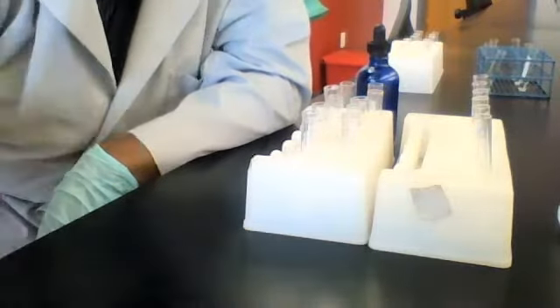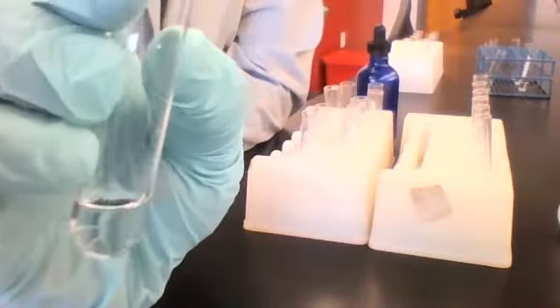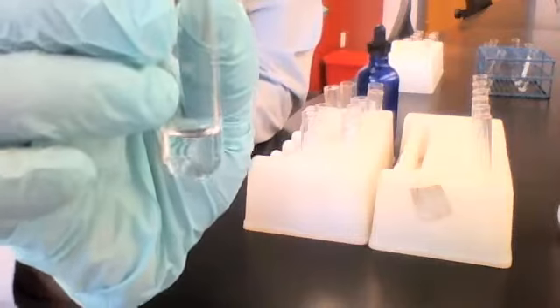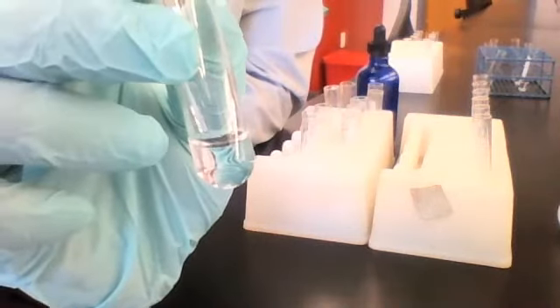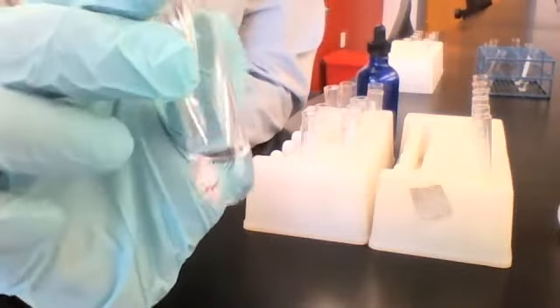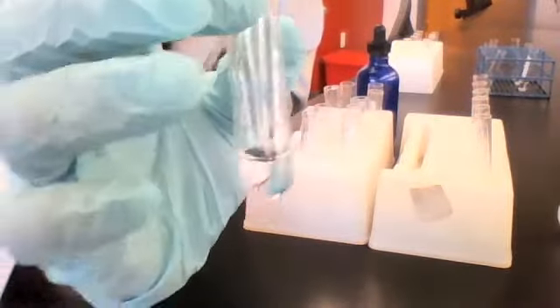All right, let's keep going across that first row of that first table. Our next solution is magnesium sulfate, MgSO4. This is what it looks like on its own. It is a clear and colorless solution. Clear because I can see right through it. It's completely transparent. And colorless because there's no color to it. There's no tint. There's no shade of blue or green or pink or anything. So this is a clear and colorless solution.